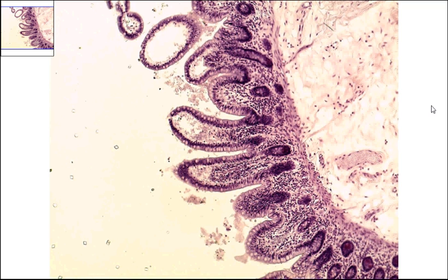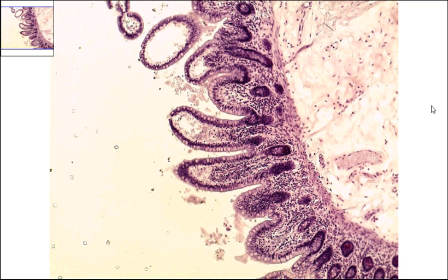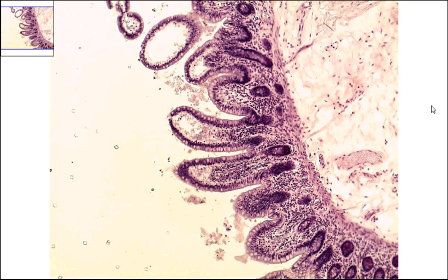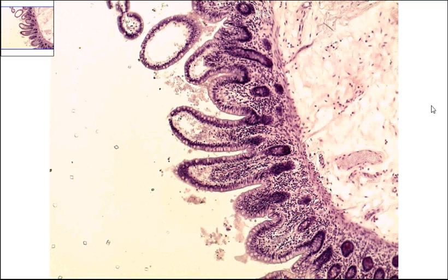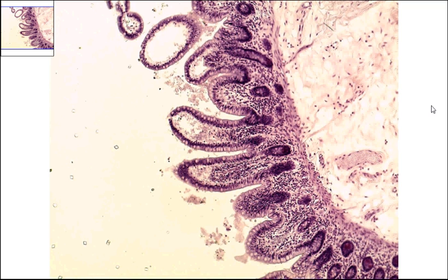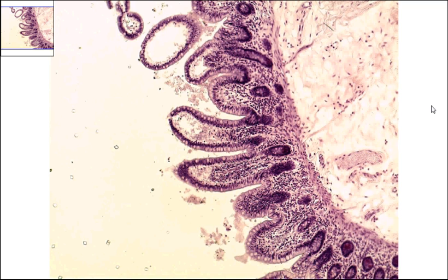This slide is from the small intestines. It is currently at a total magnification of 100x, and it will give us our example of simple columnar epithelial cells with goblets.